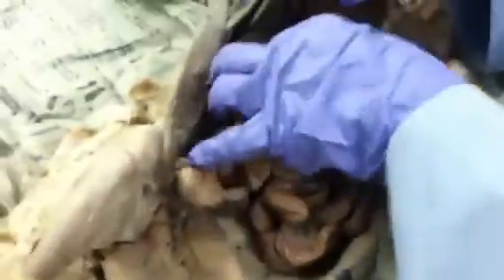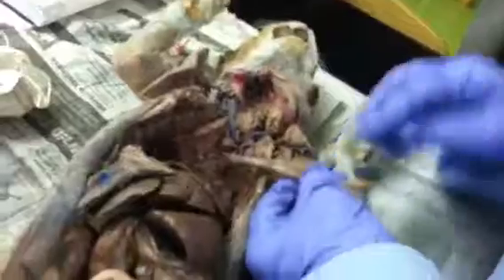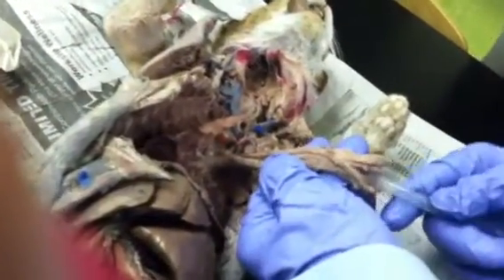What else? Did you go over the vocal cords? This is the trachea with the C rings. That's where you would have the hyaline cartilage, and then if you go through the larynx, you'll see the tracheal membrane is that soft tissue there, and right behind it is the esophagus, and the esophagus also has rugae in it. Those are the ridges.